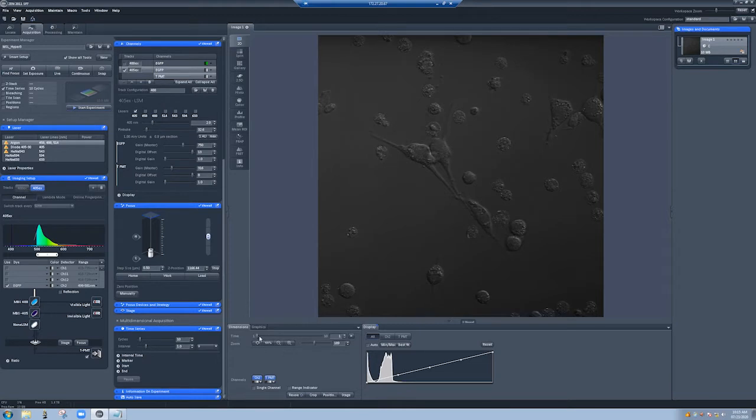Once the imaging is done, we can scroll through the time lapse by moving this slider. Now, one of the things you have to keep in mind is that when you're doing live imaging, even if the temperature is stable, there can be small fluctuations which will cause the sample to drift in the Z dimension, meaning things will fall out of focus. So there's a way to compensate for that in a manner that doesn't bleach the sample or really damage it at all, which is to use the definite focus system on the LSM710.